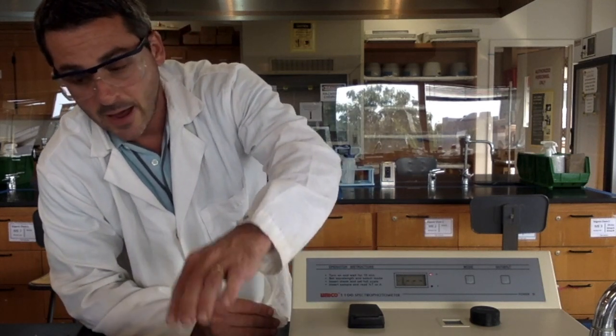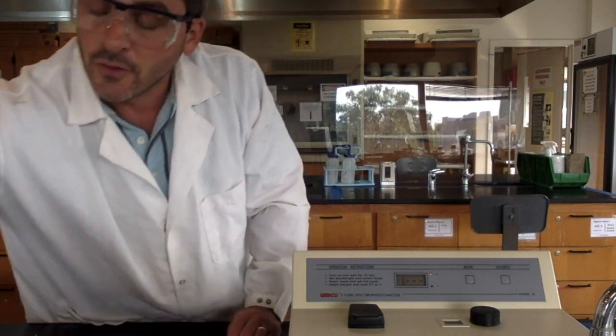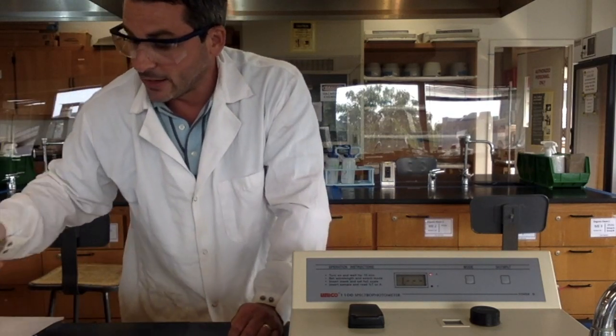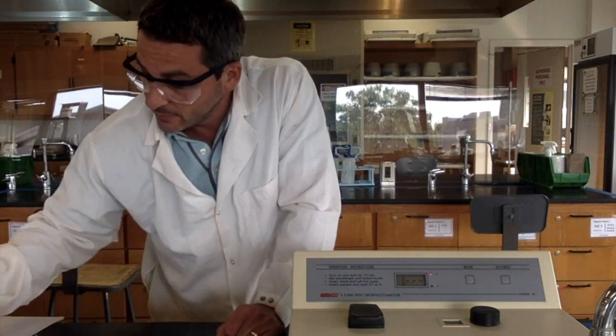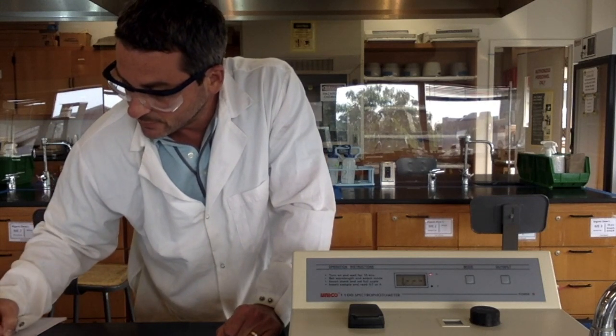Okay, so now I'm going to run the analytical wavelength. I'm going to find the analytical wavelength from a range of wavelengths from 360 to 700.